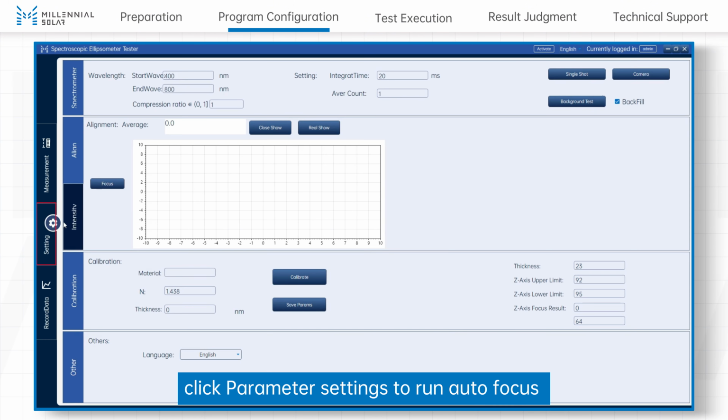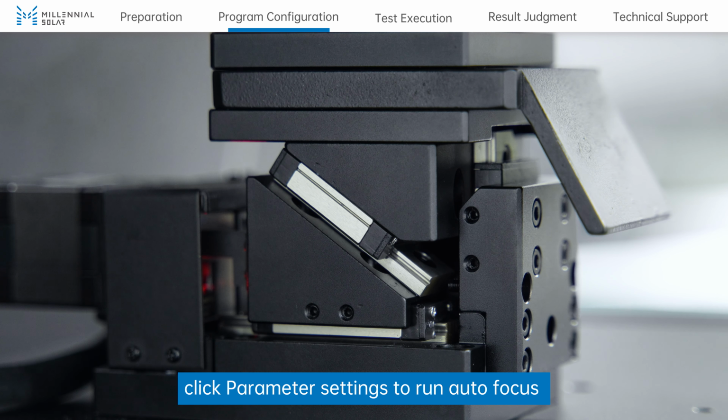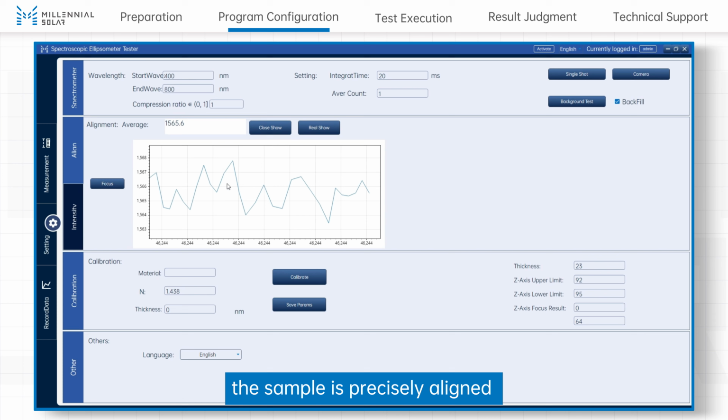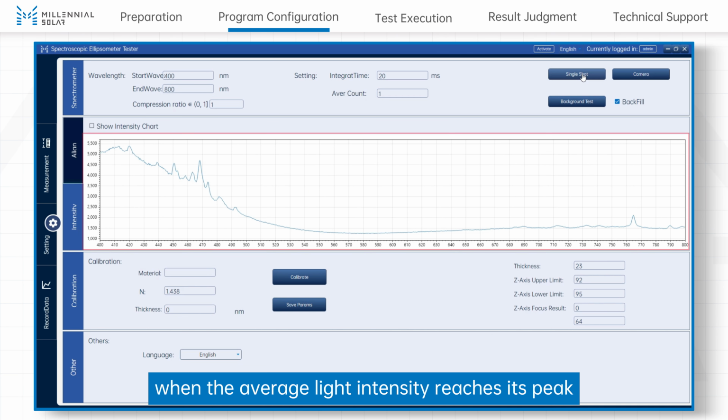Click Parameter Settings to run autofocus. Or adjust the focus manually. The sample is precisely aligned when the average light intensity reaches its peak.